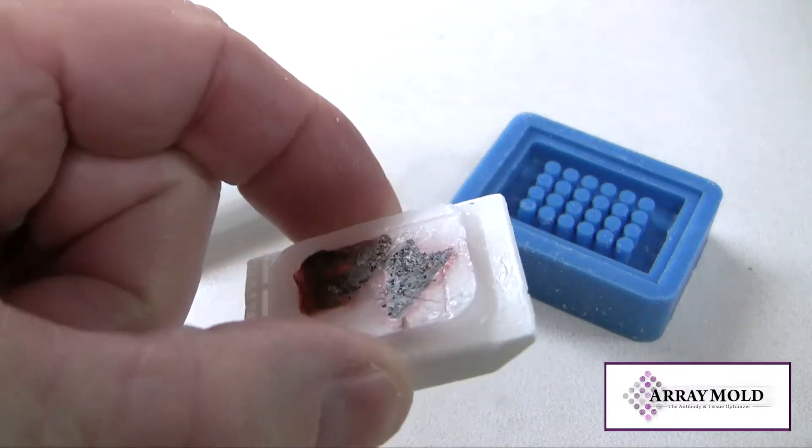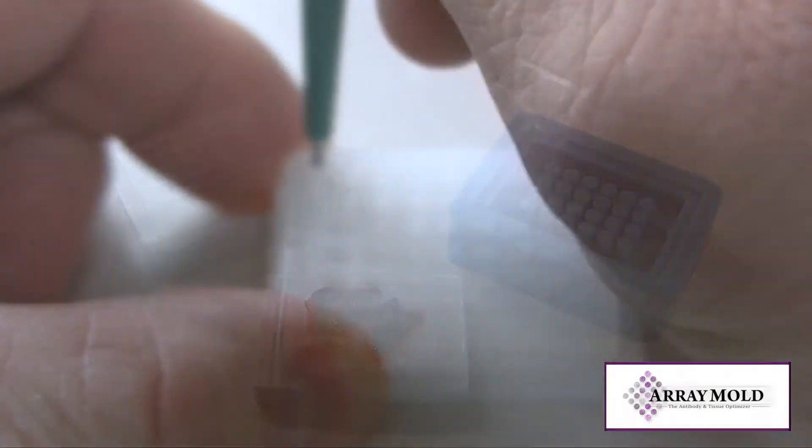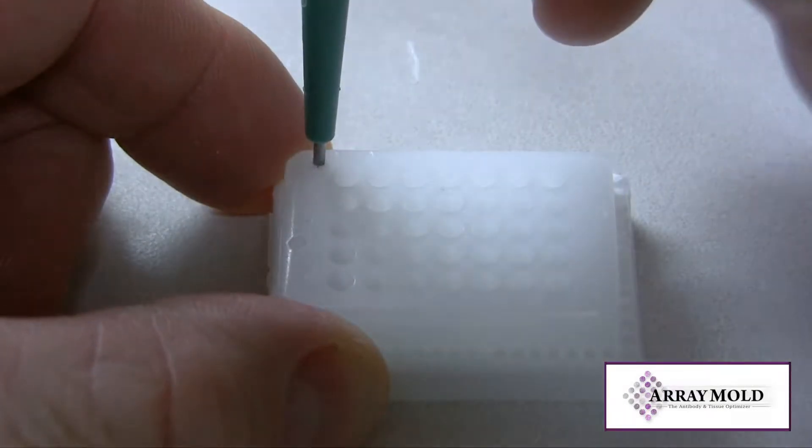This is dyed lung tissue. Any tissue will work for this purpose. We are using the 1mm and the 1.5mm needle for the location marker.